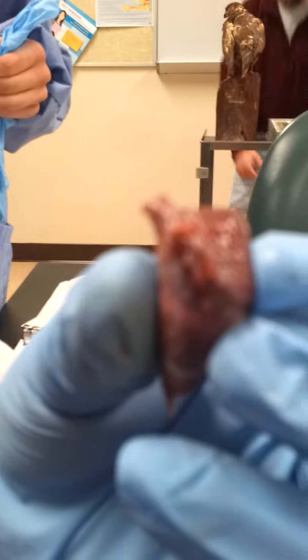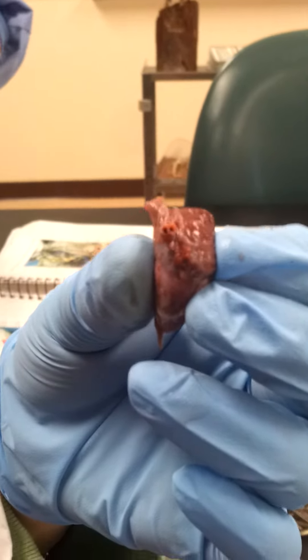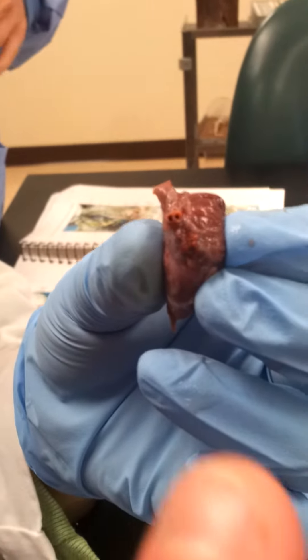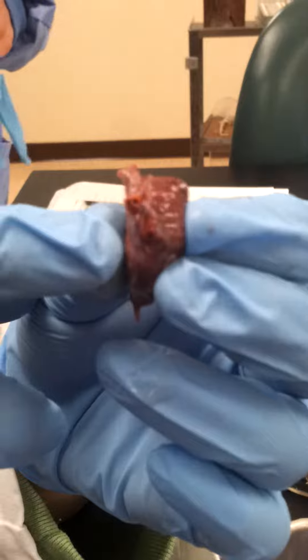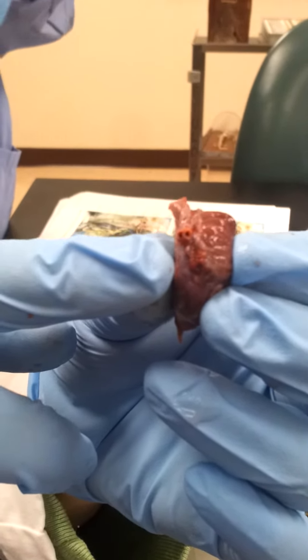The vena cava. It's going to focus in a second. I'm just going to try to stay as still as I can. Back up a little. As you can see, the entrance to the vena cava, mostly the anterior vena cava, is right there.